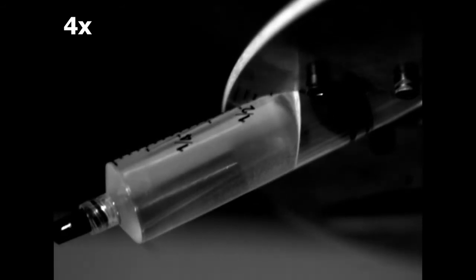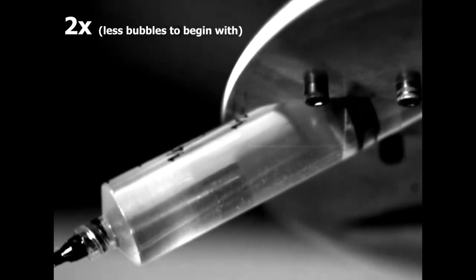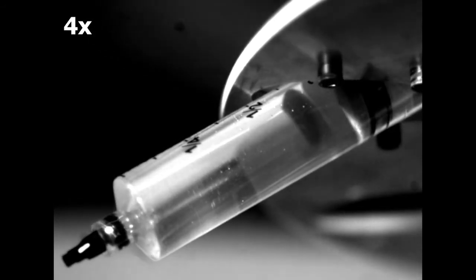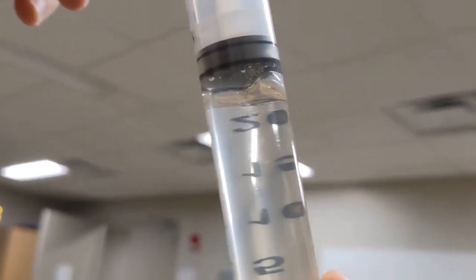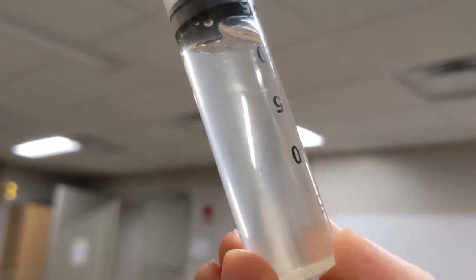In this video, we actually made an effort to make a lot of small bubbles. But now let's look at a more realistic scenario where the syringe has just some bubbles. We're gonna accelerate it, and as you can see, it also works very well to remove the normal sized bubbles. This is over the course of about 25 seconds, but we actually ran for 2 minutes just to be completely sure that we got rid of all of the bubbles. As you can see here, this is completely clear, which is just amazing. I just love this process.